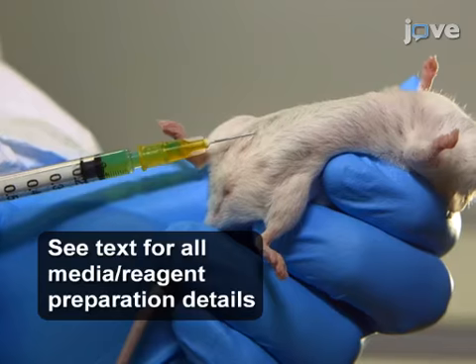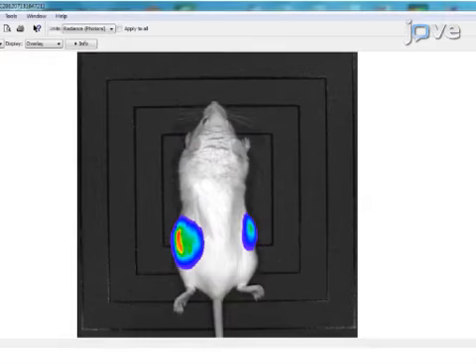In this case, tumor cells express firefly luciferase. This protein oxidizes D-luciferin and produces light that can be detected with the imager.